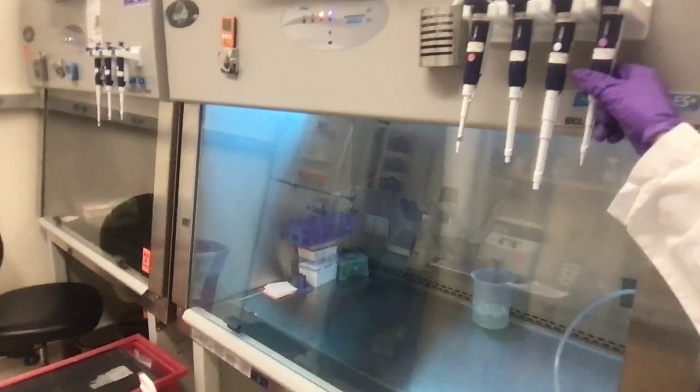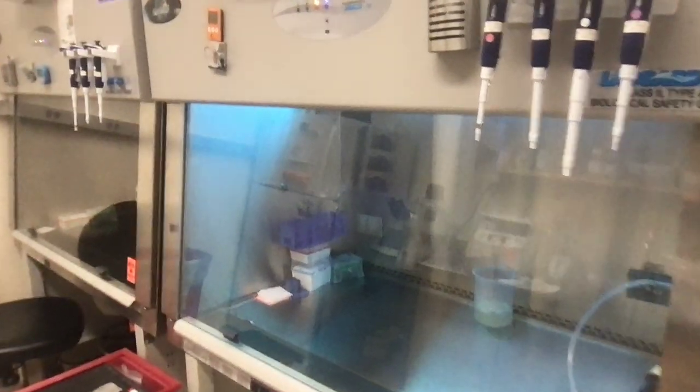You can see some pipettes up here, so really common laboratory instruments. Within a biosafety cabinet, you can see that there's a device that's just like a pipette. It's like an automated pipette, basically, because it quickly draws up liquid without you having to continually press or depress a button. We have some more pipette tips on that end there, and we have some containers in there to hold tubes and various stuff.